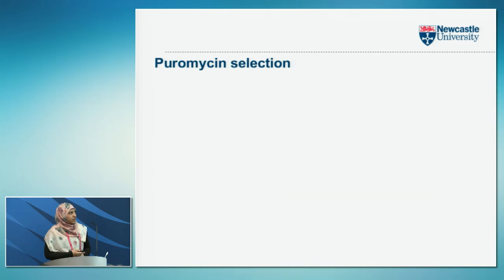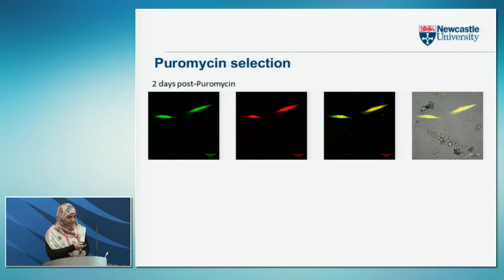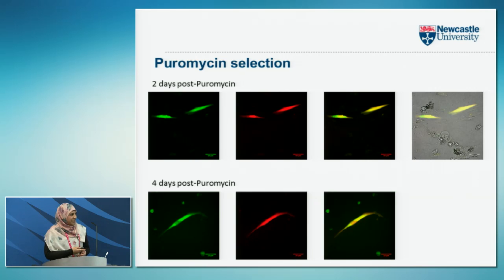So we moved on to puromycin selection. So the cells that had picked up the CRISPR knockout had HDR, and so they would be GFP positive, RFP positive, and puromycin resistant. And we found that cells were surviving that had all these three qualities, but 4 days after puromycin, we had very few cells remaining.